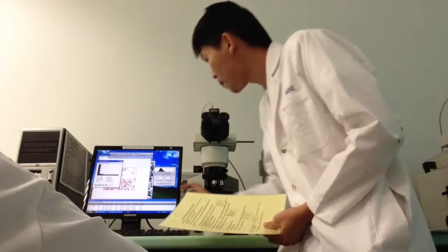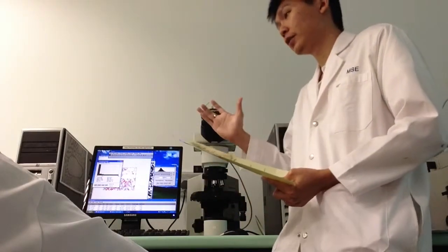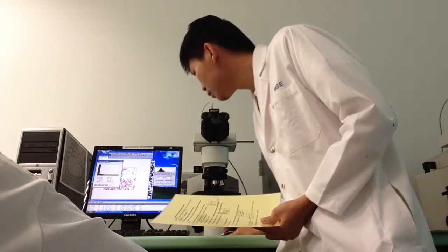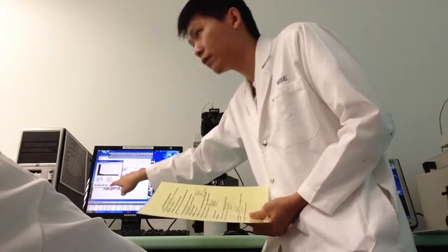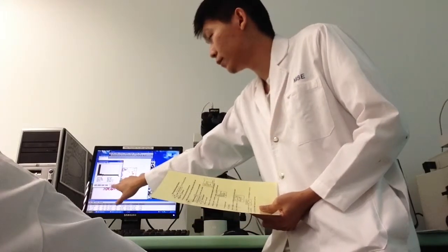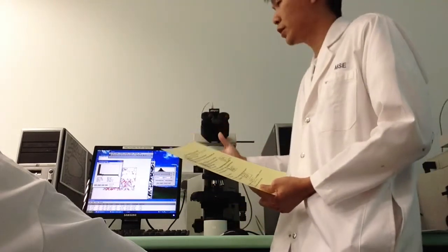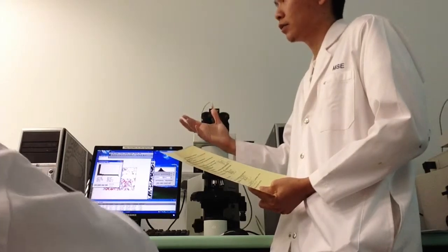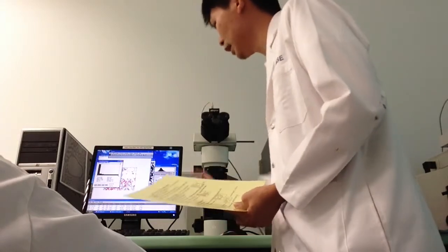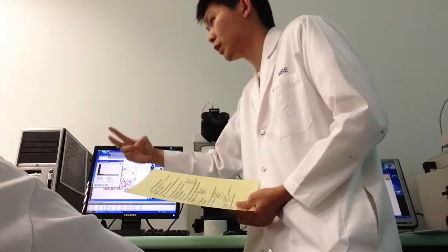Okay, so here you can just change the range. No, you should see this value over here, which is 20. It's not 8, value 20. So let's say you want to change your range, right? You just add roughly around 20. So I can just blow up the thing from 0 to 40. Okay, just 20 plus 20, 40.